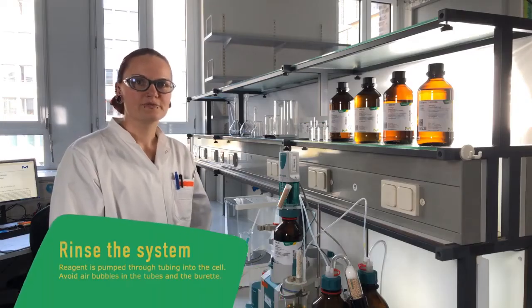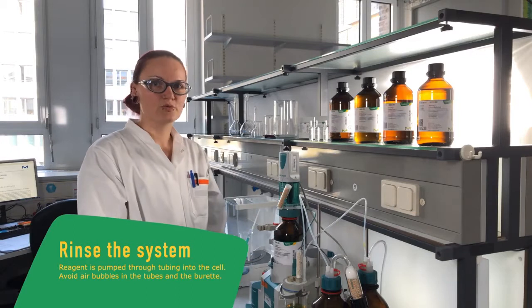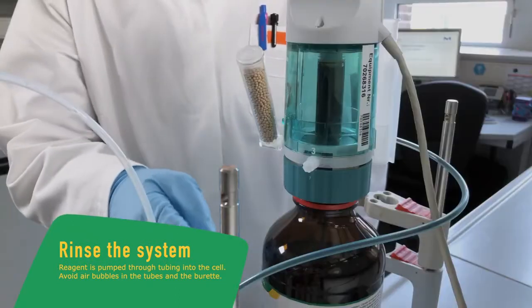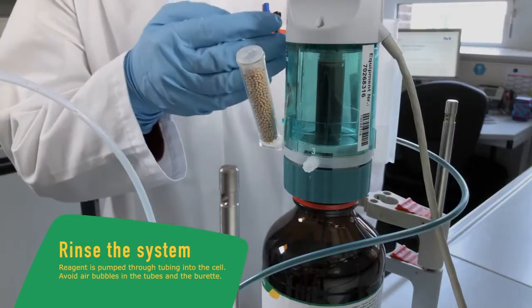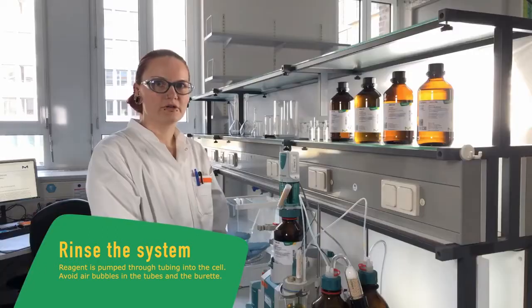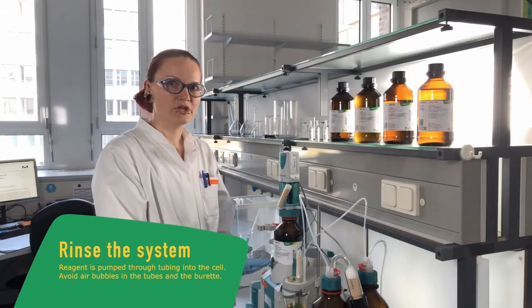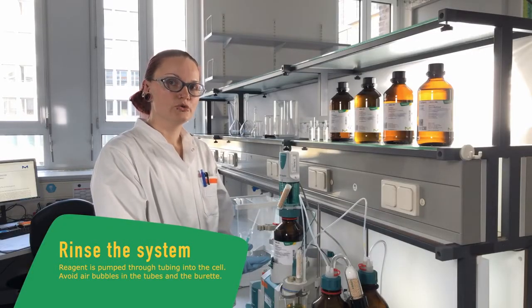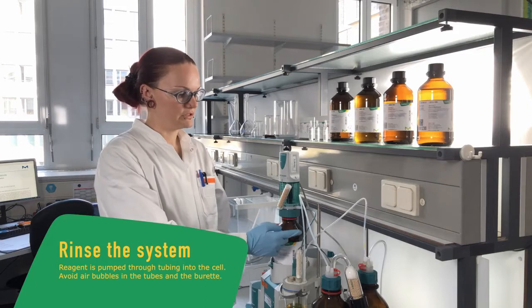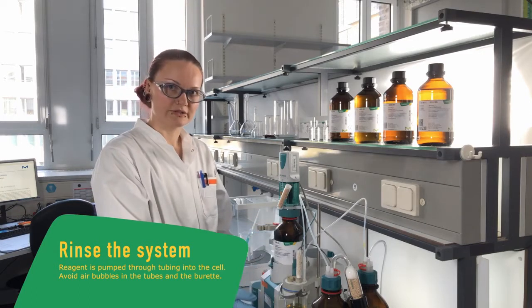First we have to rinse our system at least twice to make sure that there are no air bubbles in our tube or the burette. The concentration of the reagent may change due to incoming humidity or evaporating solvent.